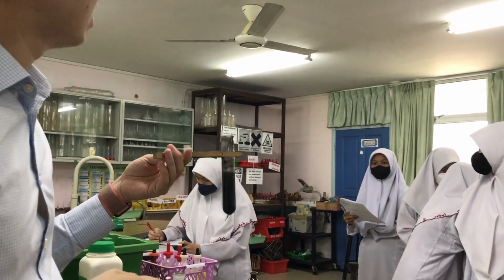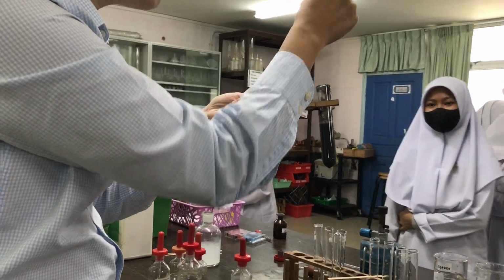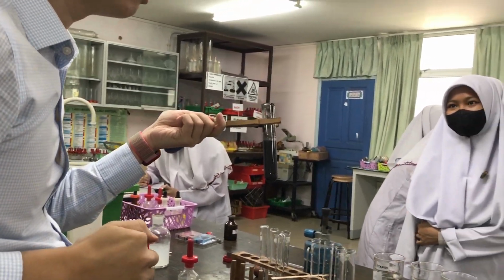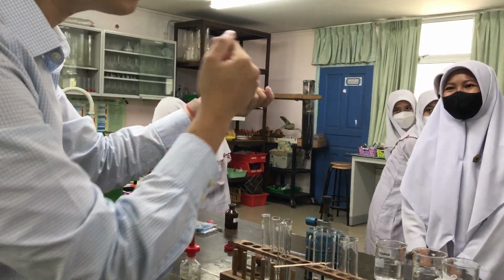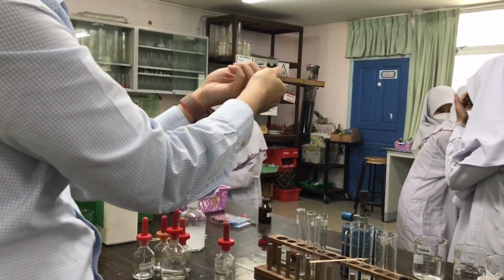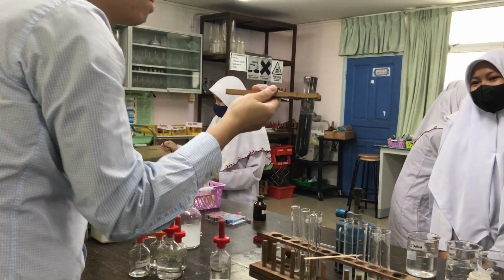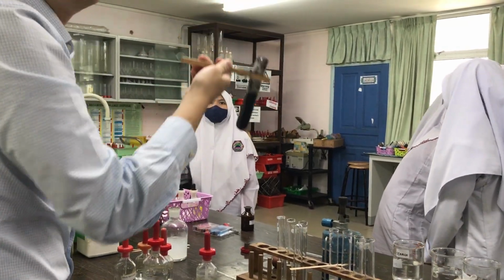Azira, come, Azira. How do I get the black solid from the solution? Are you going to pick up one by one? Okay, do it for me. Pick up one by one. I thought you said you're going to pick up one by one. She said it, right? So how are you going to give me the black solid? Tell me. Any idea? Filtration.